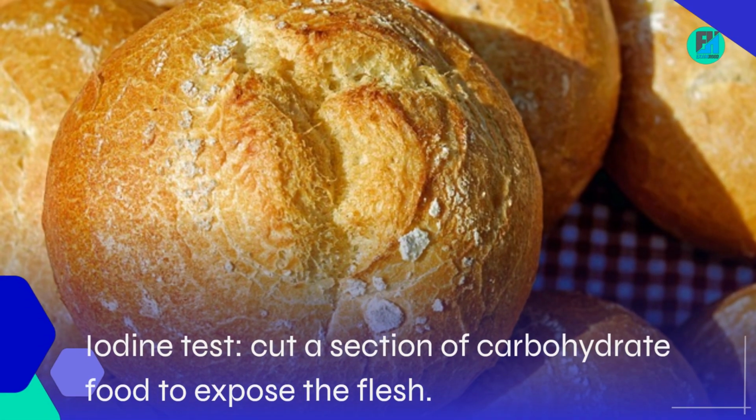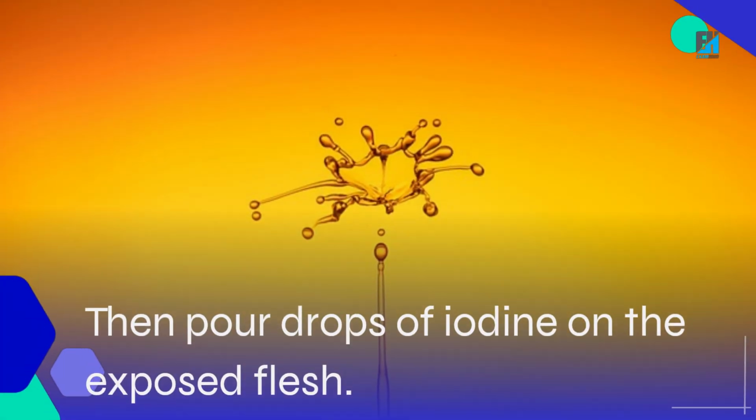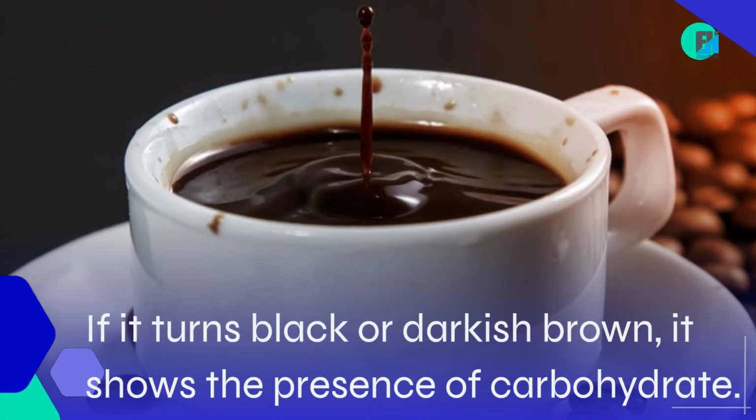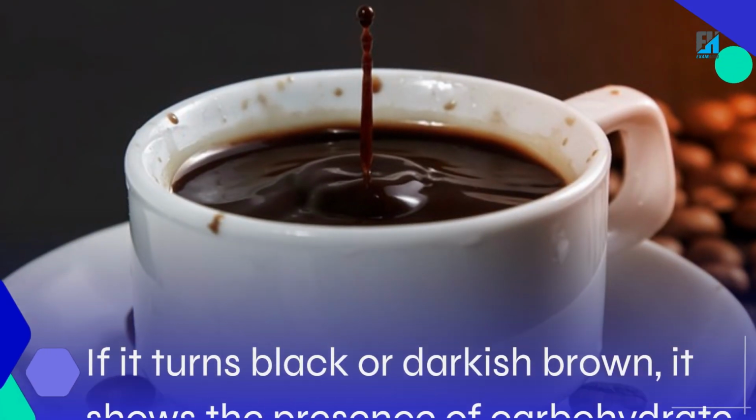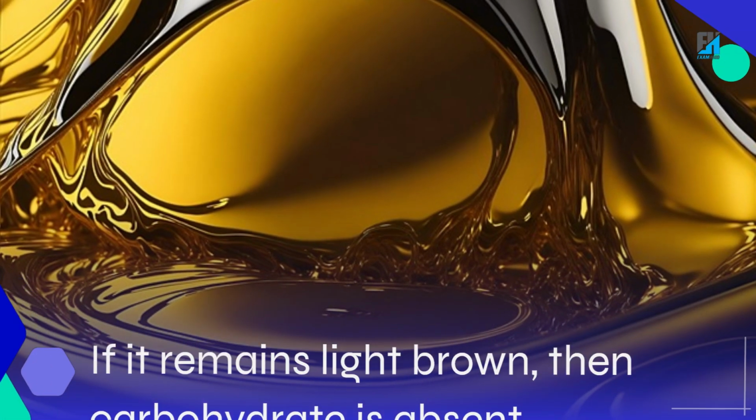Carbohydrates. Iodine test: cut a section of carbohydrate food to expose the flesh. Then pour drops of iodine on the exposed flesh. If it turns black or darkish brown, it shows the presence of carbohydrate. If it remains light brown, then carbohydrate is absent.